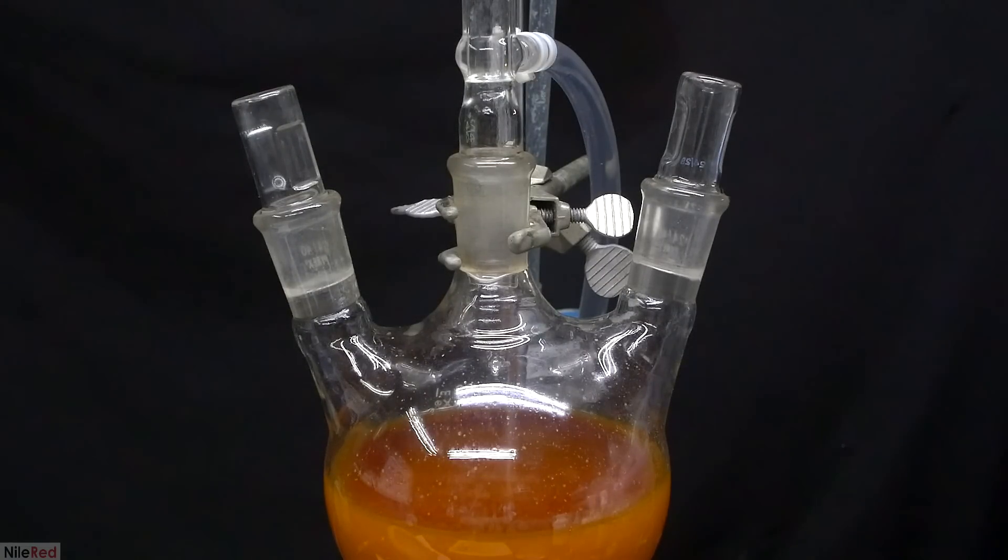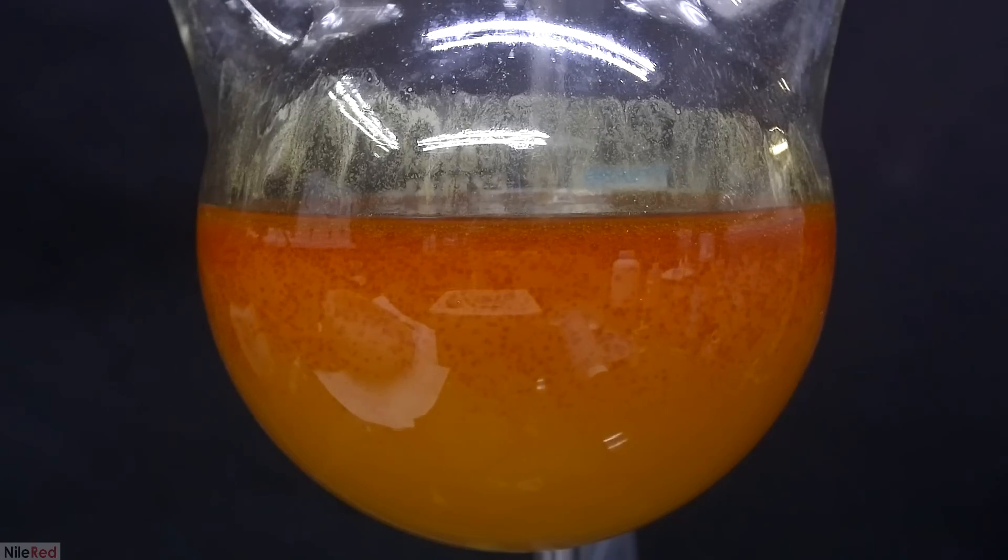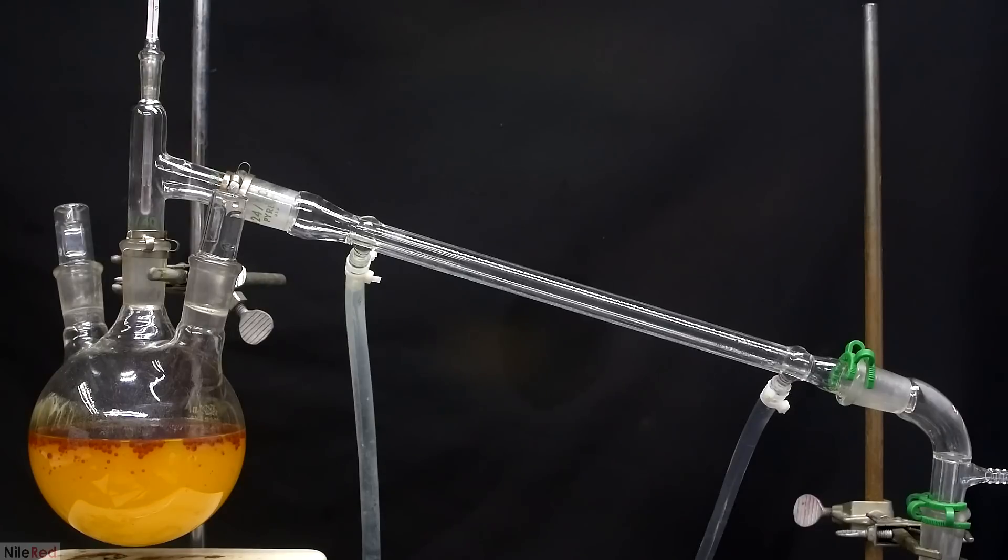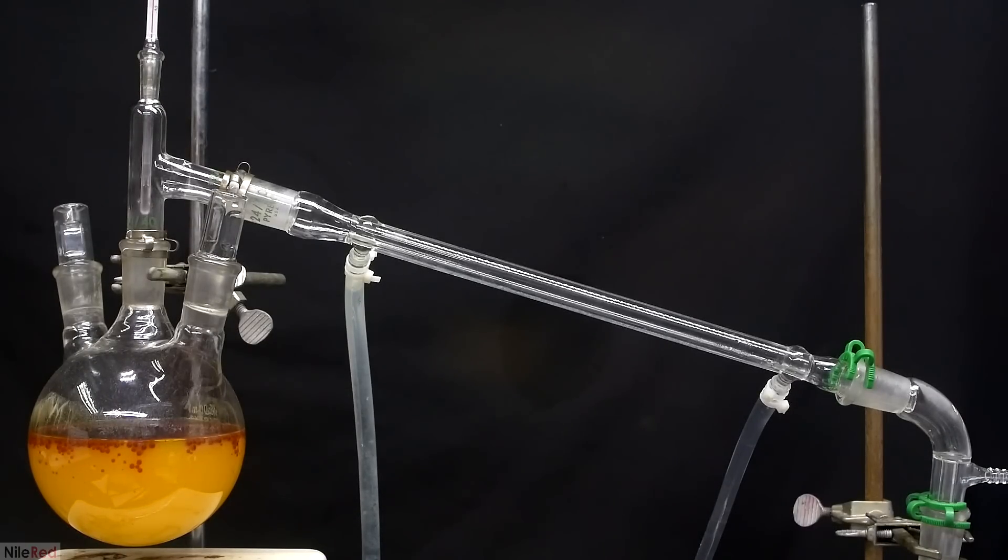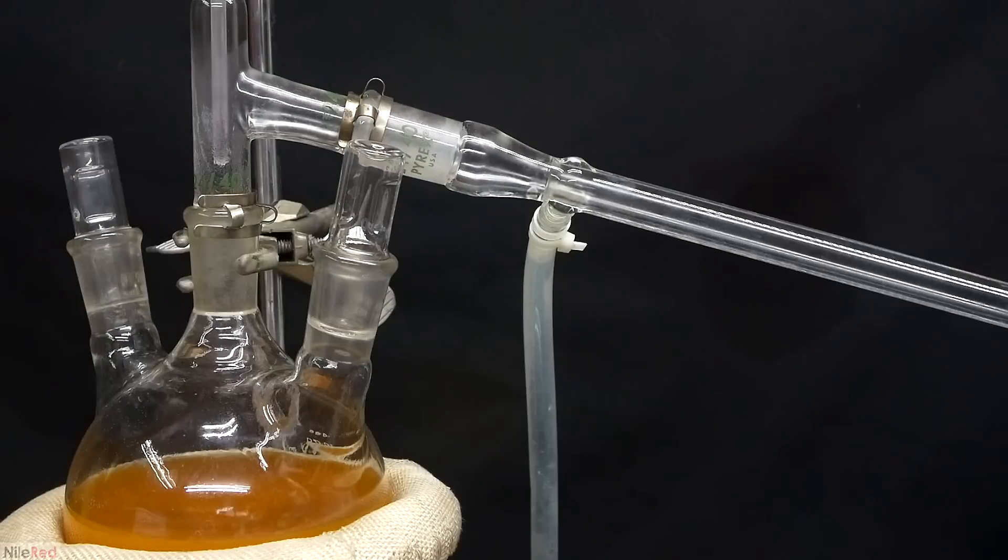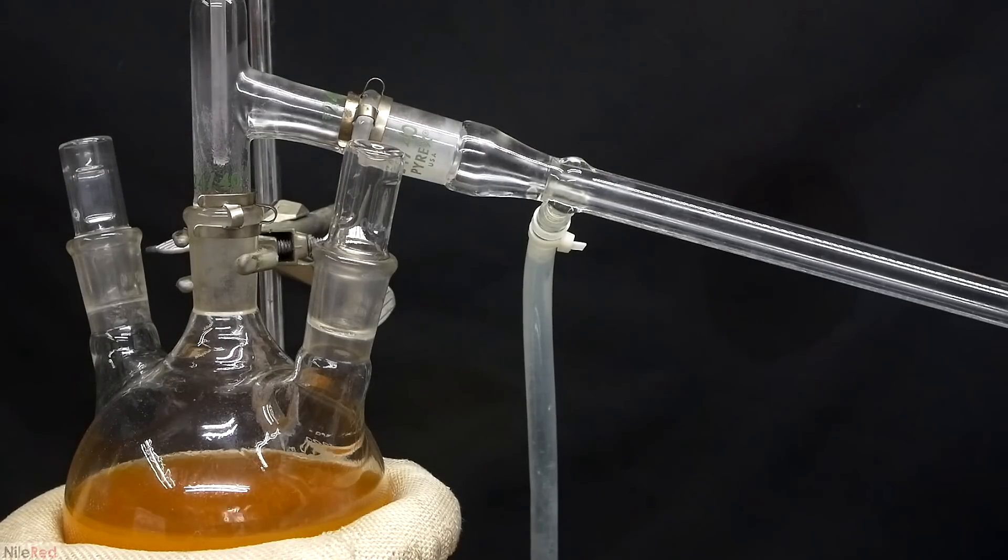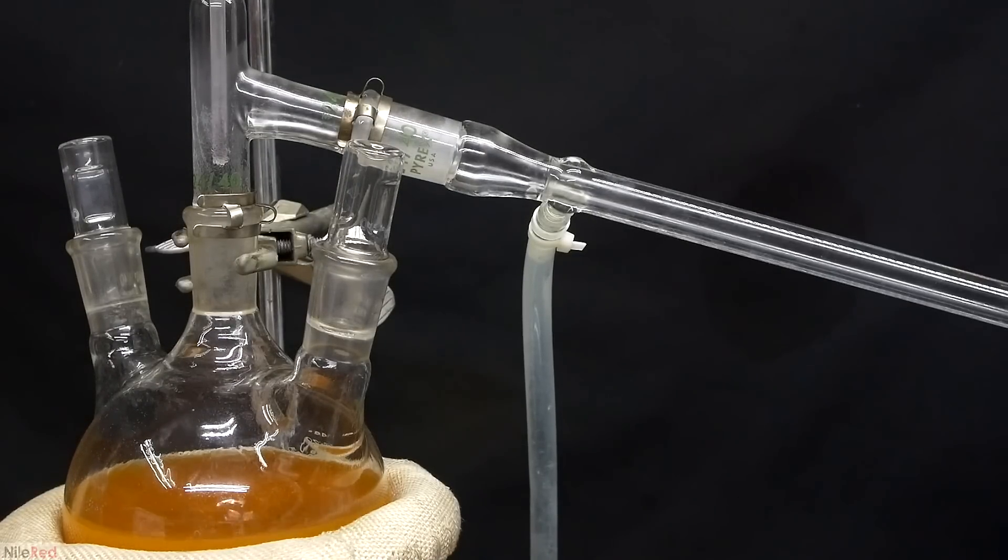After eight hours, the reaction is taken off heat and we set things up for a steam distillation. The setup that we have here for the steam distillation is pretty much just a simple distillation. The basic premise here is that as we heat things and boil off water, our desired benzaldehyde will co-distill.